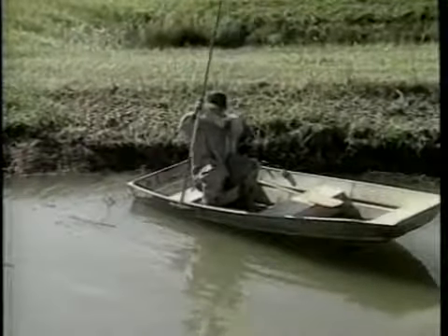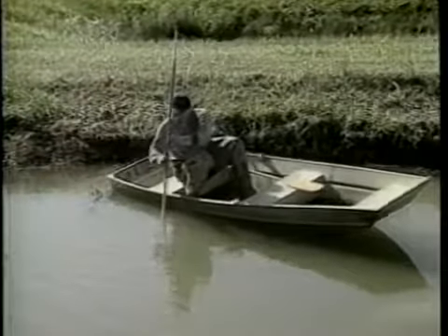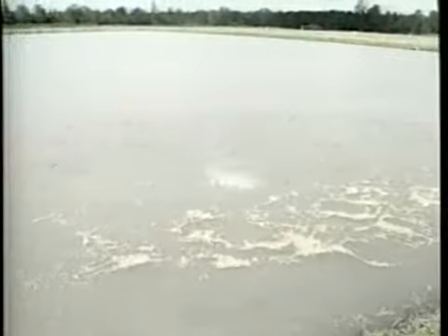A Secchi disc visibility of 30 to 60 centimeters is generally adequate for good fish production and for shading underwater plants. In ponds in which fish are fed, it is virtually impossible to regulate phytoplankton abundance. Therefore, the Secchi disc visibility is only a simple indicator of abnormal conditions.